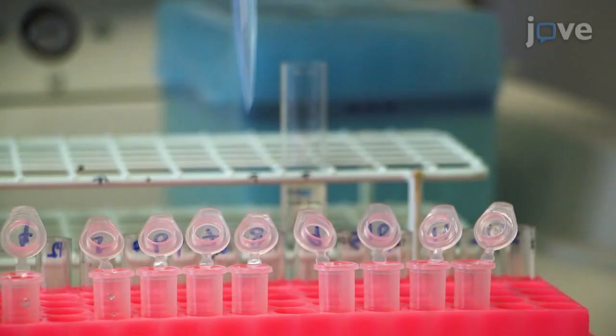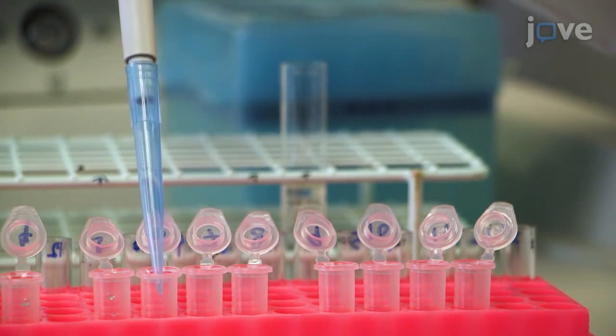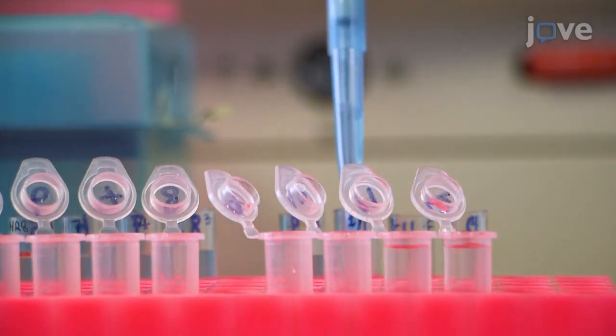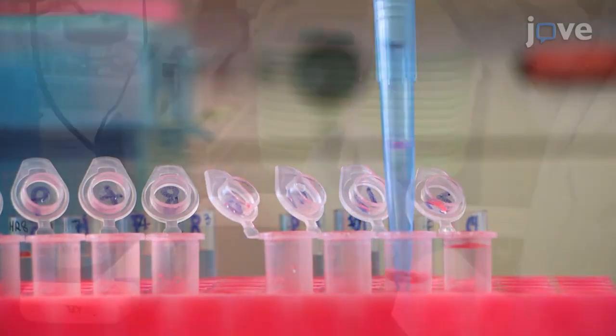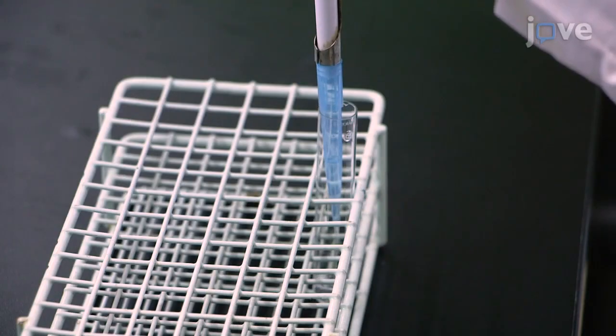This protocol helps in isolating the recycling endosomes containing fraction from transfected mammalian cells to facilitate the investigation of protein trafficking via endocytic trafficking. This technique is easy to handle and applicable to both tissue and cell samples.